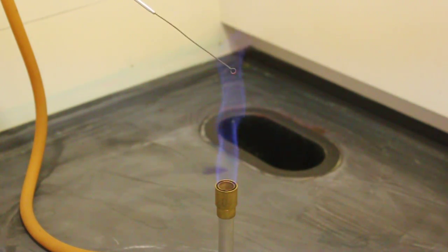Now I would start with the loop end, turning it bright orange first, and then continuing up the inoculating loop until my entire wire turns completely orange.